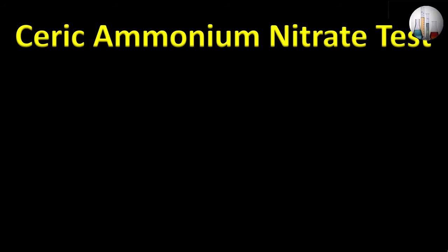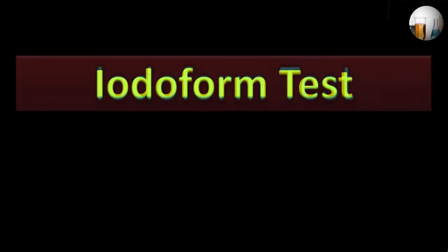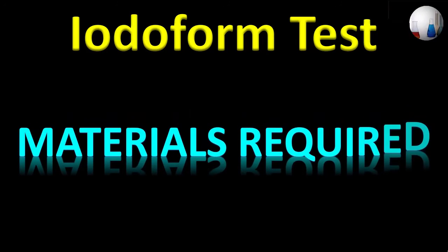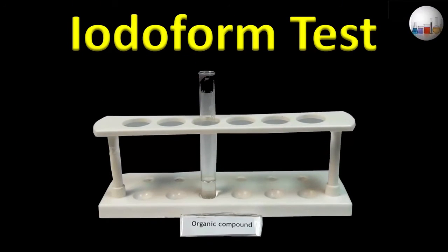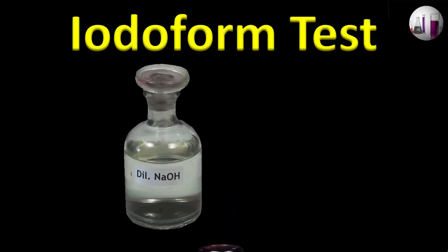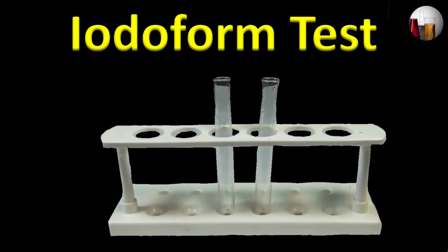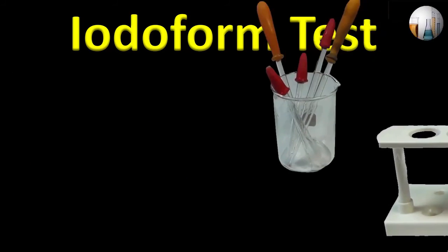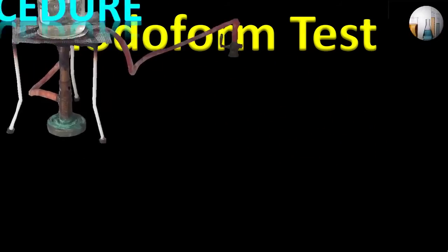The next test is the iodoform test. Materials required: organic compound, 1% iodine solution, dilute sodium hydroxide solution, test tubes, droppers, and water bath. Now let's see the procedure.